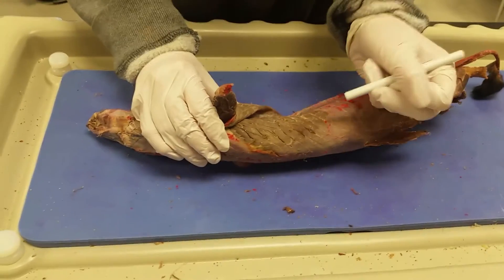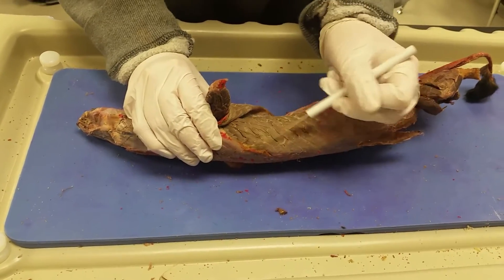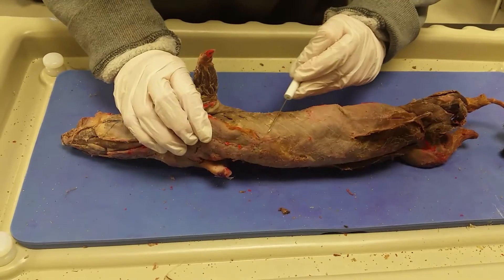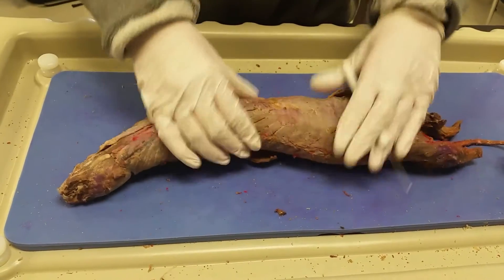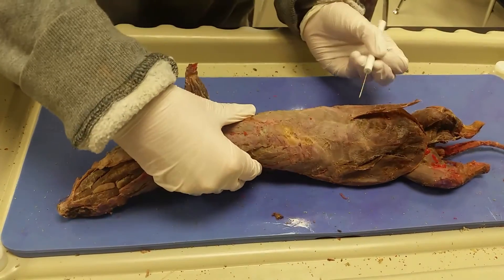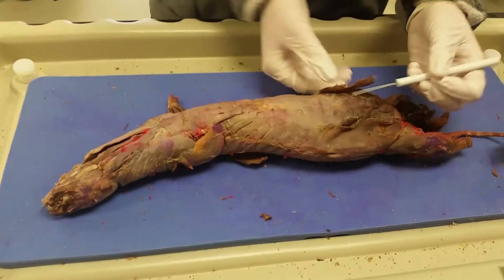The serratus ventralis weaves in with the external oblique. The external oblique follows this grain all the way down to the top side of the torso. As you can see, we have dissected the external oblique out on the very bottom.